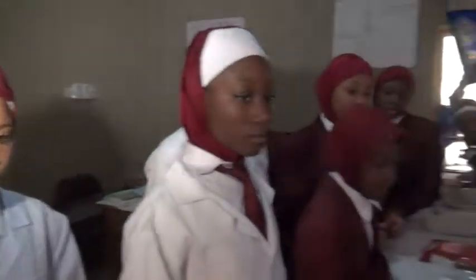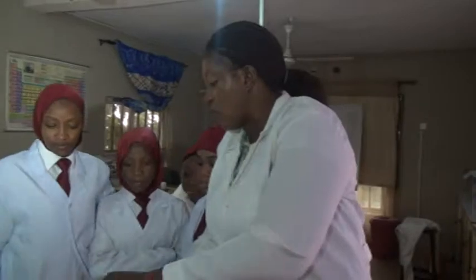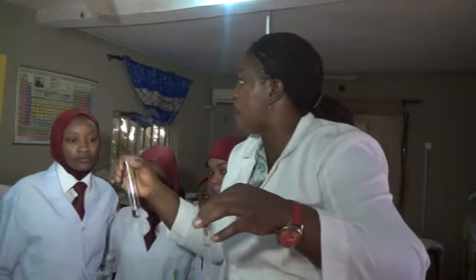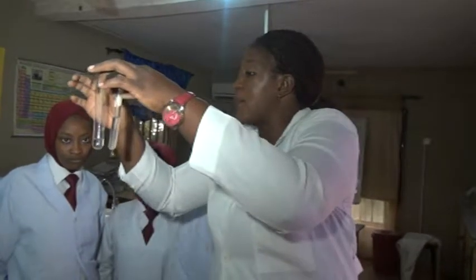So our next practical is going to be a very simple one. Down here in the lab, you will notice that most of the chemicals are colorless. Though we have some that are colored, most of them look colorless, and you can't even differentiate between one and the other. Now, one of the commonest of them is the acid and the base. Both of them look colorless, like water. That is why one of the rules in the lab is do not eat or drink anything in the lab, because you don't know what you are consuming. It might look like water, but it is not water.